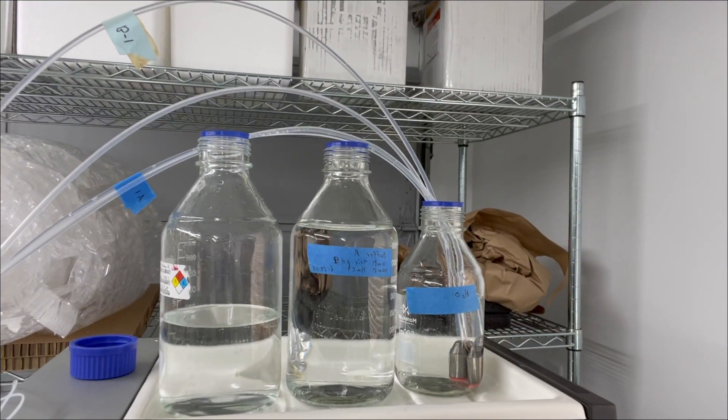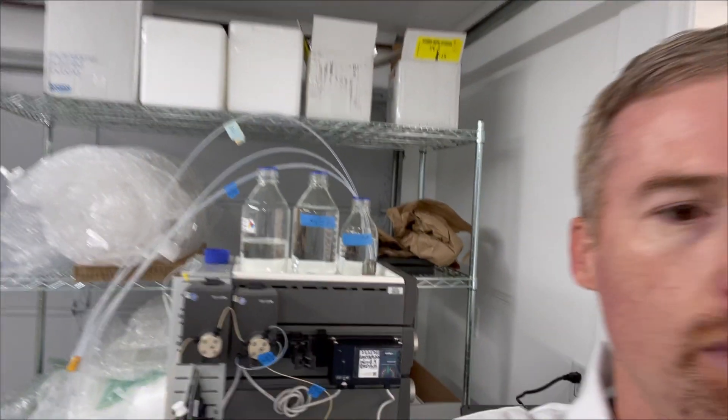Not only to prime pumps but also to get rid of the air. I think you can see here there's some air bubbles in the lines and we don't want those getting into our columns. So we've got to clear those out.